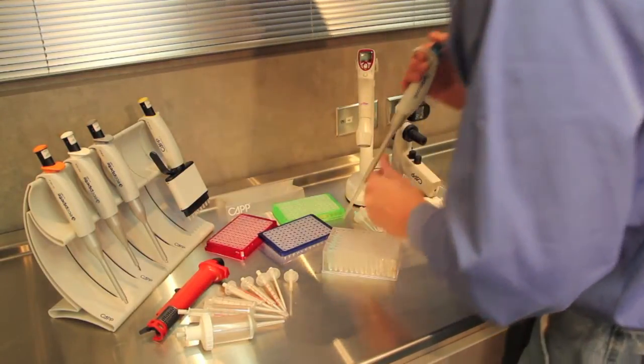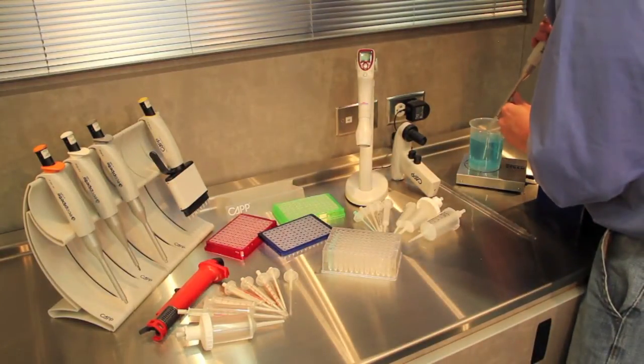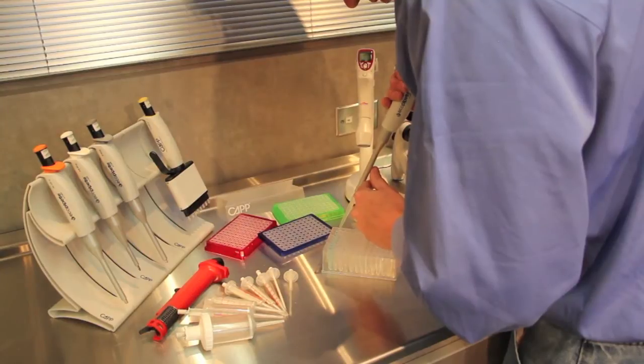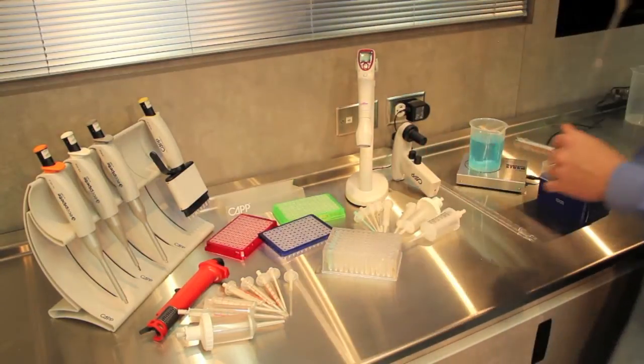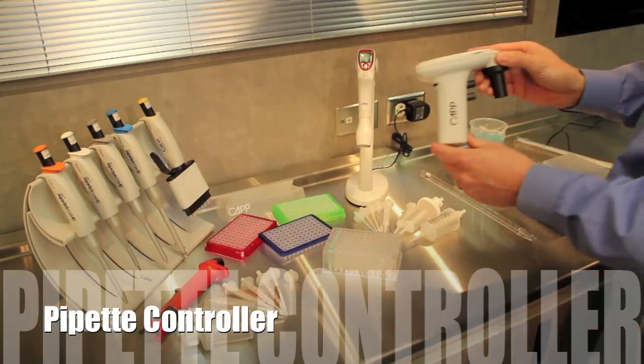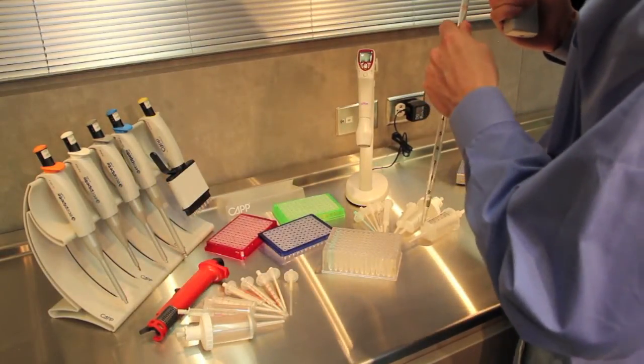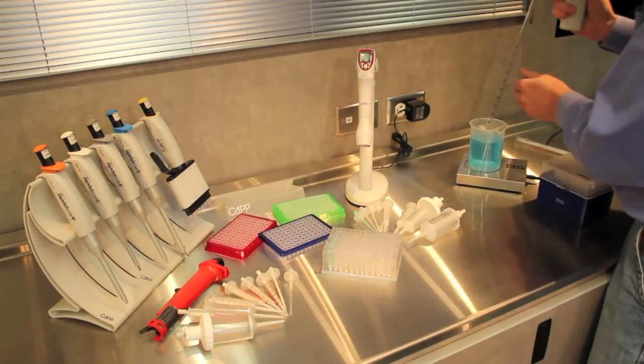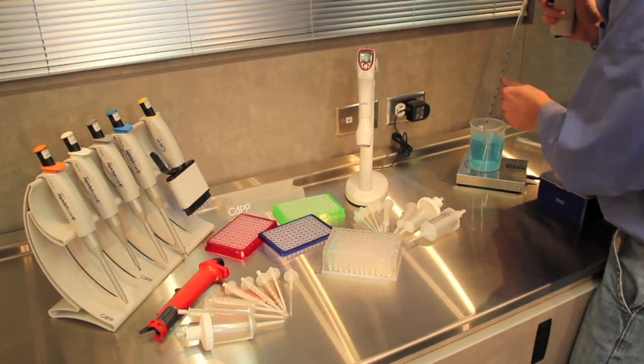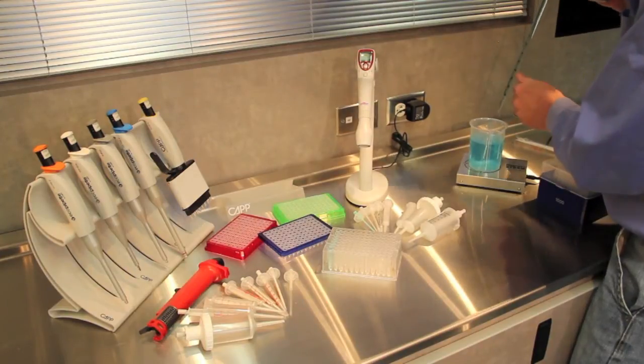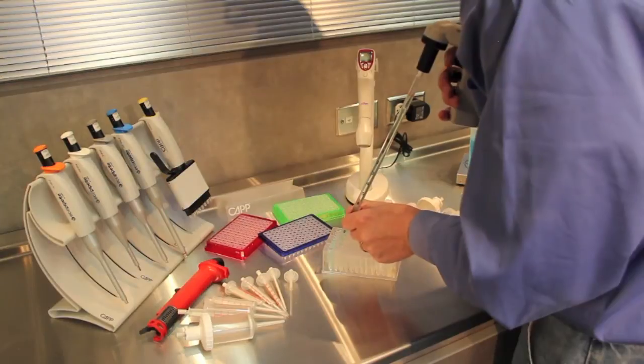The next one we're going to use is a pipette controller and a serological pipette. We simply load up the serological pipette and aspirate up the liquid. Now this will be much faster than the pipette, but it is not going to be anywhere near as accurate.